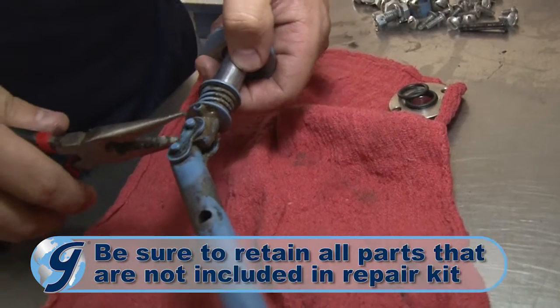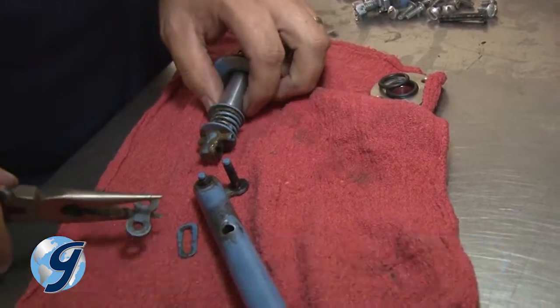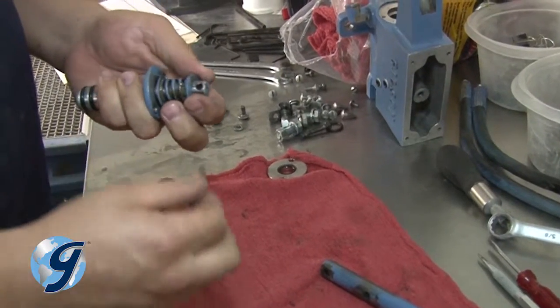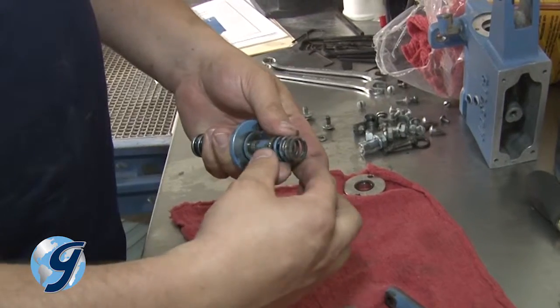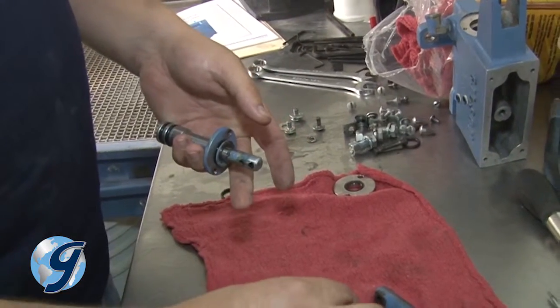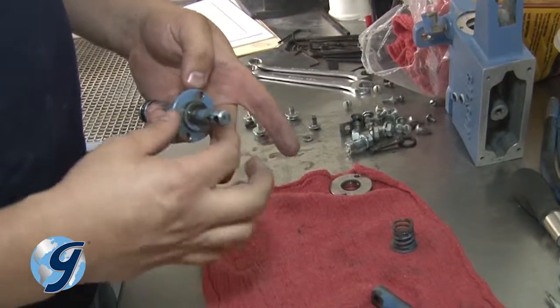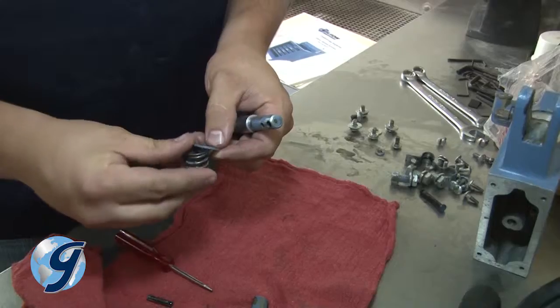Take apart the plunger from the handle assembly by removing the chain link clip and pulling the link out. Next, drive out the spring pin that holds back the stroke limiting spring and washers. Once removed, slide the limiting springs and washers off, as well as inspecting the old guide and seal before setting it aside. Now, clean the plunger and affix the two new plunger O-rings.